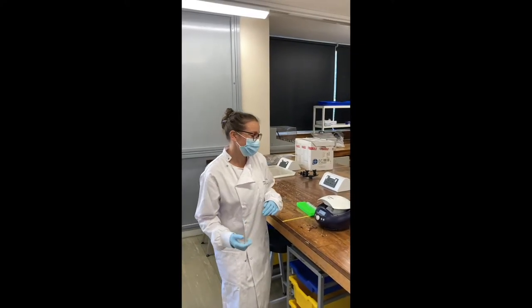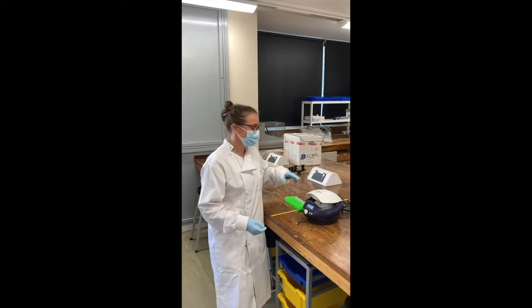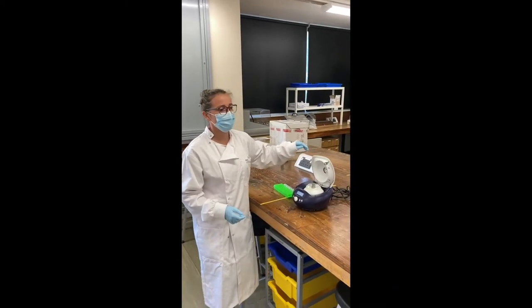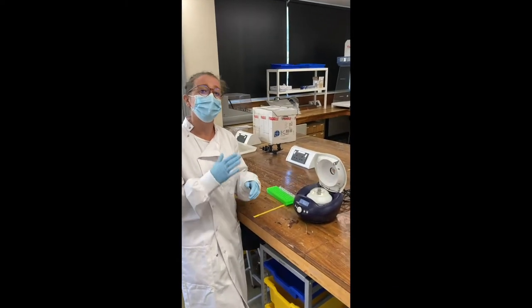Hi guys, I'm going to talk through with you today how to use the centrifuge. You use centrifuges in certain practicals where you have to pellet out a sample with liquid.